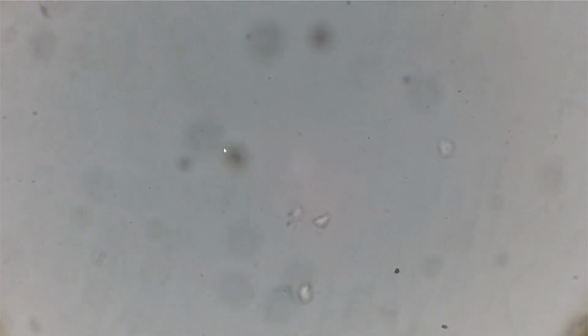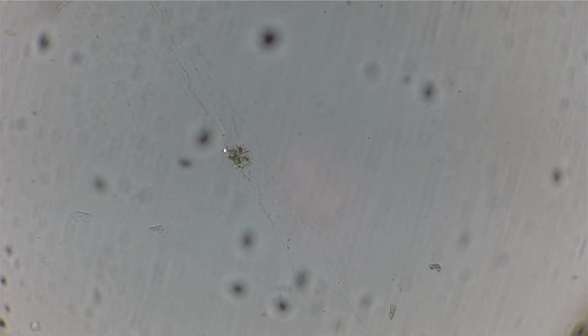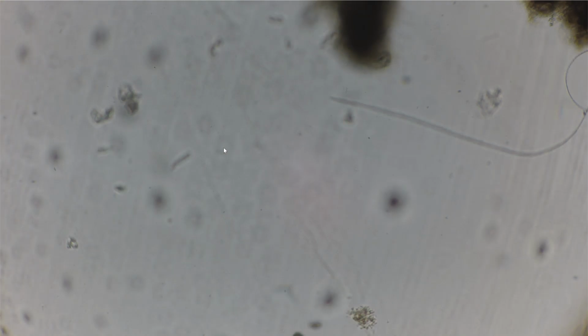Soon I will update the newest version of this program that also gives the tool to transform the images into NumPy arrays to be able to import them directly into PyTorch and TensorFlow.